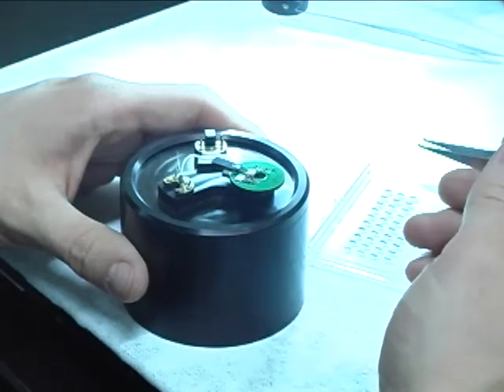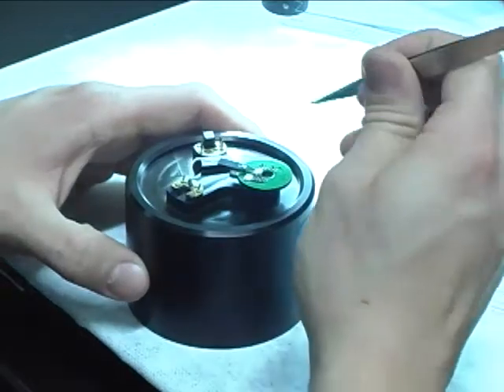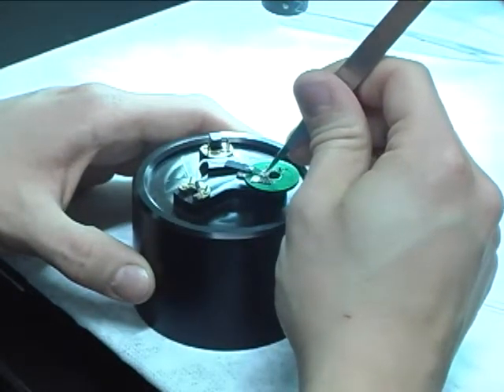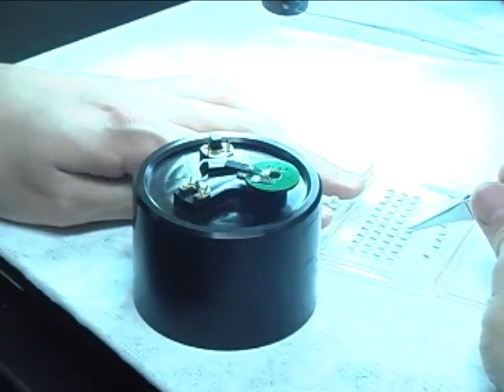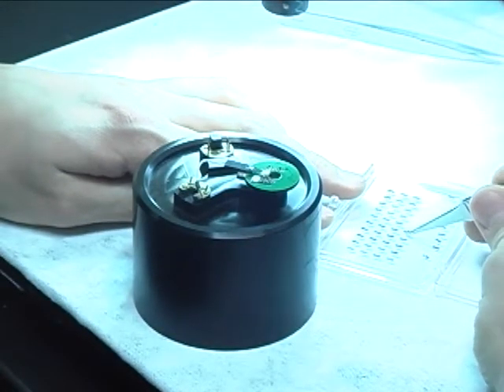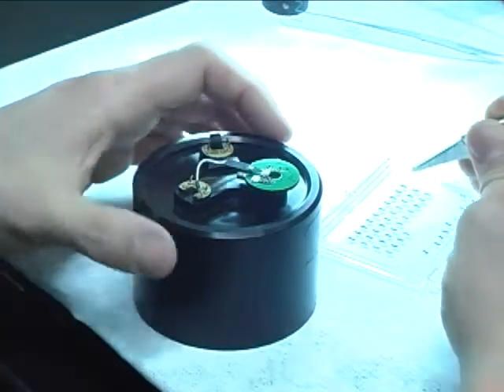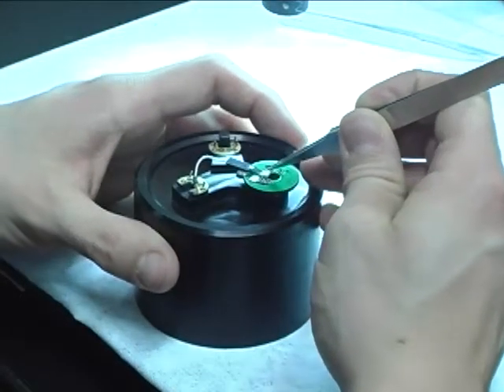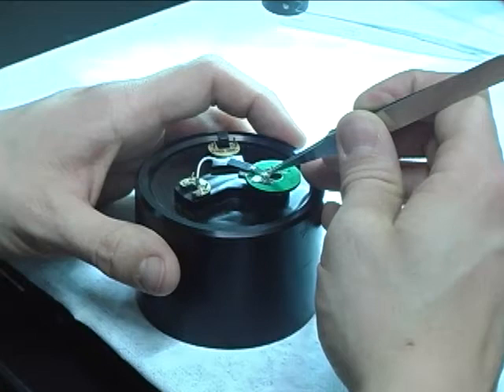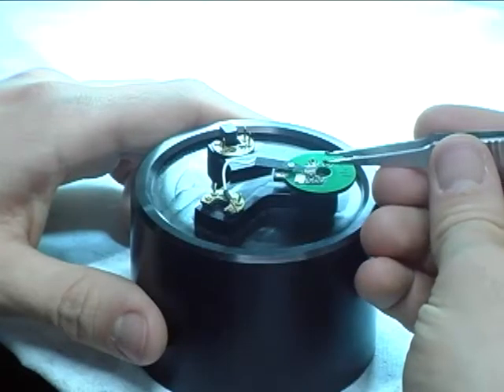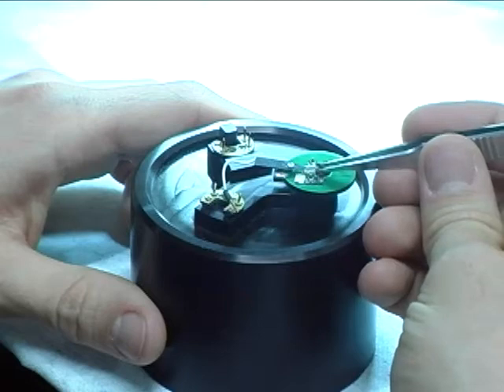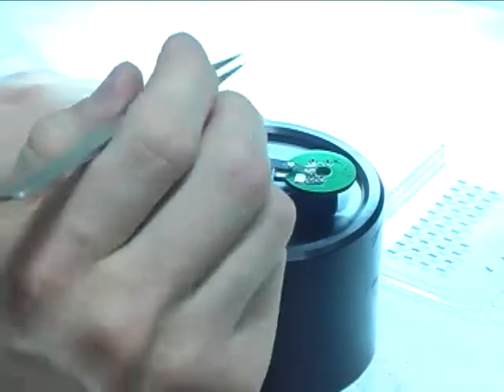So first off, we'll check to make sure that there's no dust or any particulates sitting on the surface of our mount. And then we will gently pick up the cantilever chip and place it on the mount. Make sure that the chip is centered in the mount.